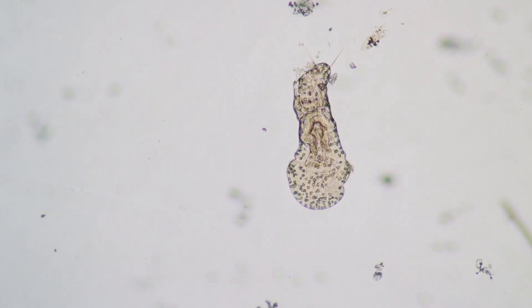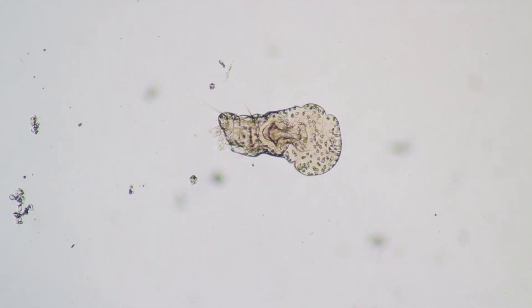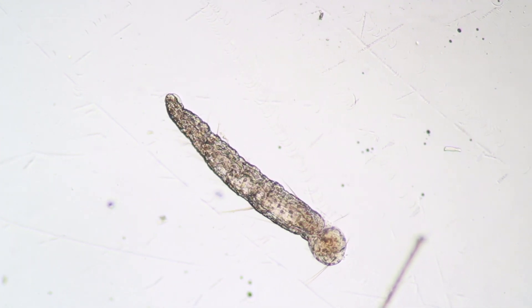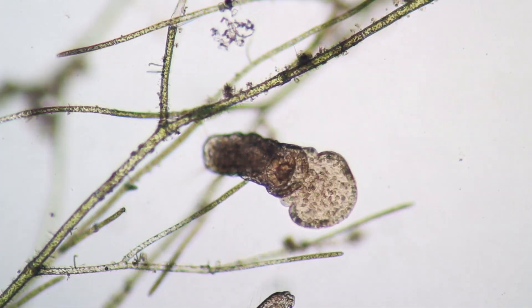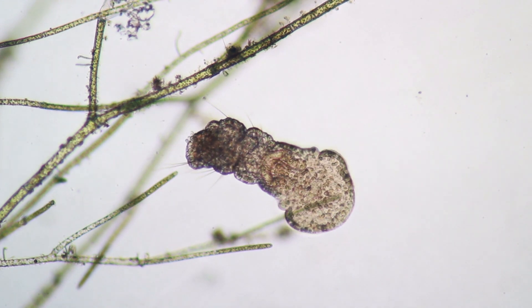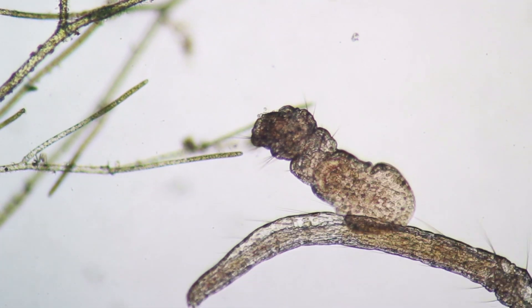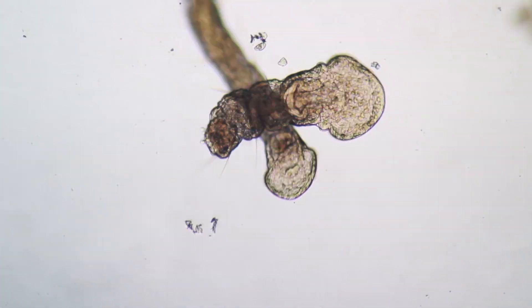You see another body part here — another stump on the left side, because I did chop several worms apart. There's a little bit of time-lapse here. Small little cilia — small little hairs on the head — also move algae and other food material into the mouth. Again, the rest of the body: the digestive system is still working, it's trying to move forward but not really working well. It's also quite interesting to see how they start to reproduce asexually, because sometimes they will split on their own to form two different worms.